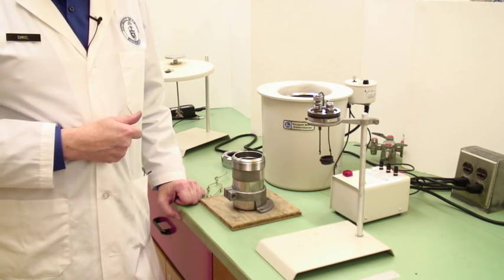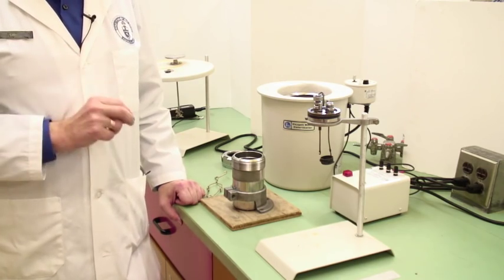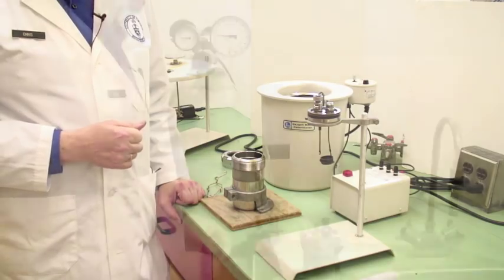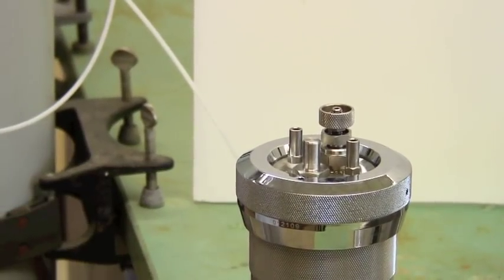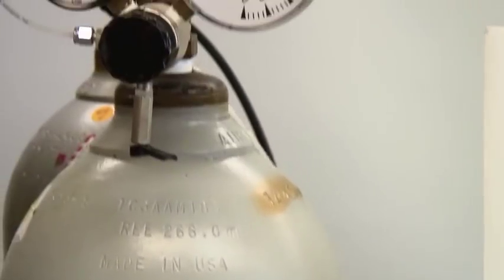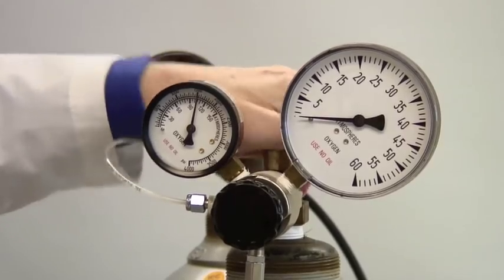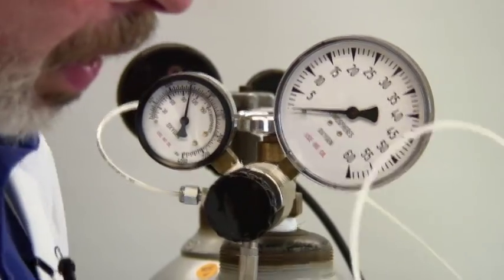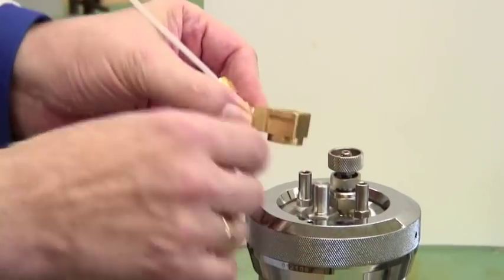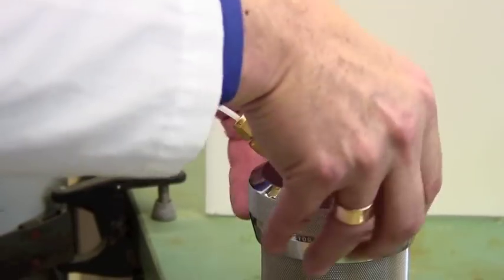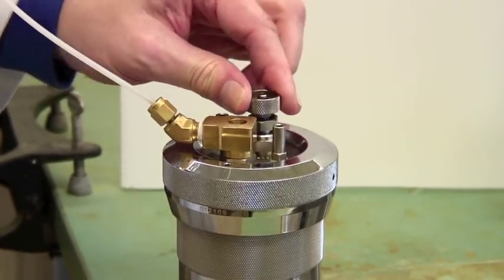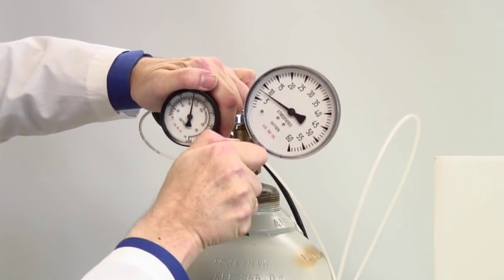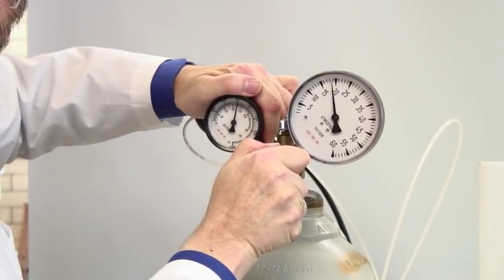There's a couple of other things that I need to show you, and that is how to prepare the charge and how to pressurize a bomb that has a different oxygen inlet. This is the alternate, in fact the newer style of charging outlet here. And this is how you use it. Again, turn the valve on the top of the cylinder open if it isn't already. This one's got 1500 psi in it and no pressure coming out. This is a smooth slide-on fitting. Just with the tail moving up, you just push it down firmly like that. As simple as that. Make sure that this valve, the release valve, is tight. And then use this knob to add oxygen into the bomb in the first place.